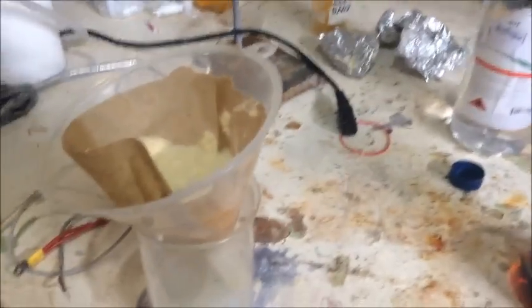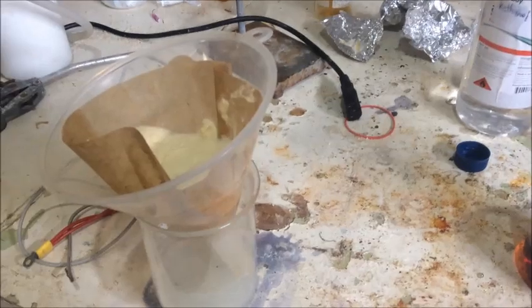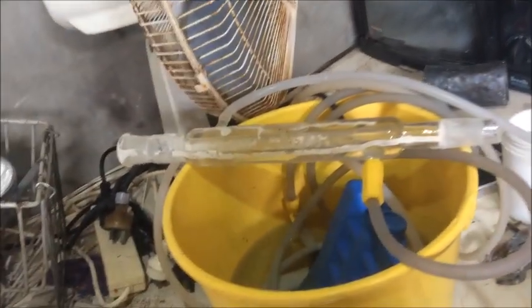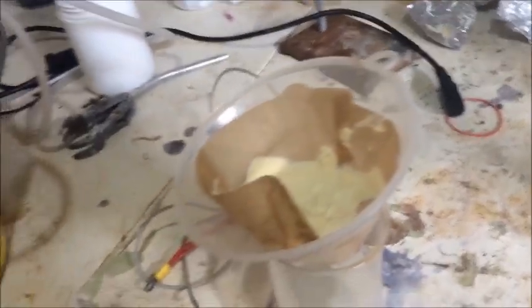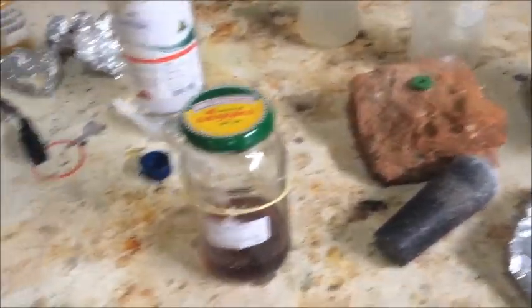And that's the last one of my 500ml flasks. So I'm down to one 250ml flask left out of my flask collection — with the jointed glass, obviously. It's got all aspirin in it — I had to hydrolyze the aspirin to get the salicylic acid. So I'm going to have to buy new flasks, which I'm not too chuffed about. Well, I mean, I'm excited for buying glassware, but I'm not very excited about spending money that I don't really have.